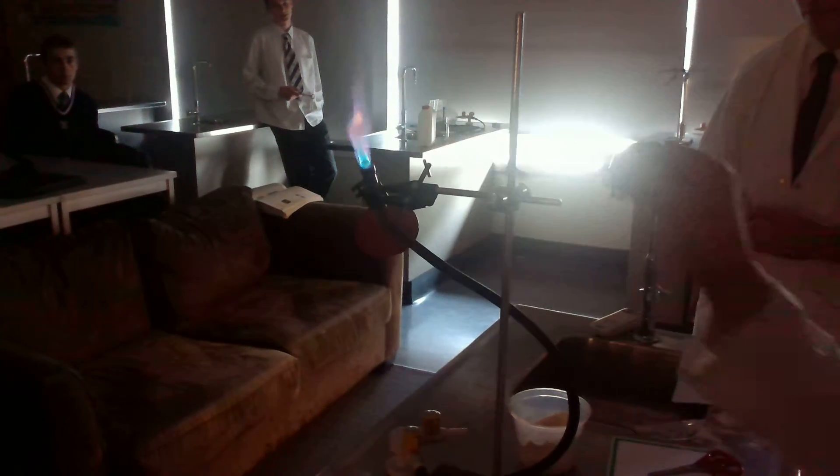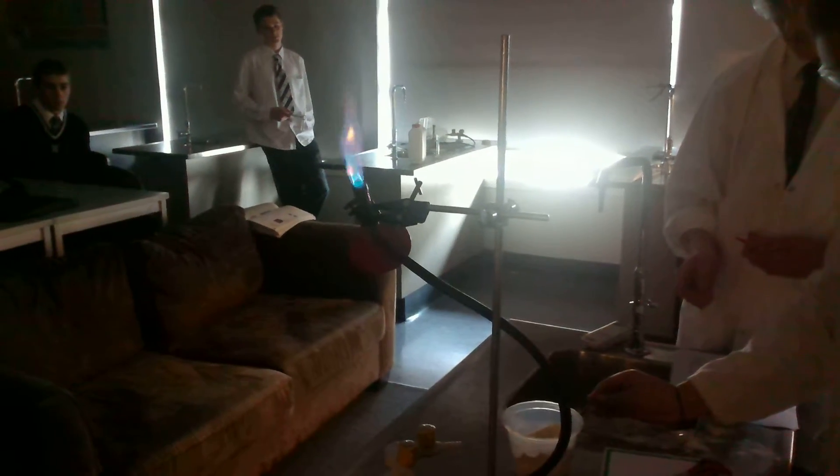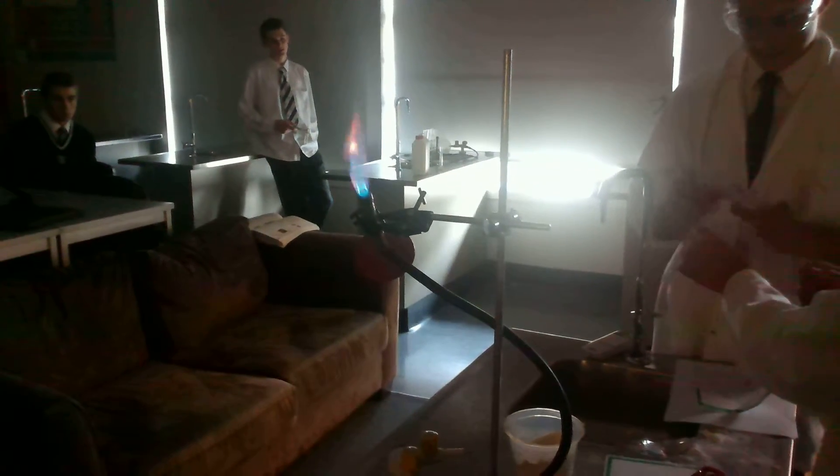Now we're going to compare that to putting some flour through via a bottle, which will make the particles spread out more so more surface area will be exposed.